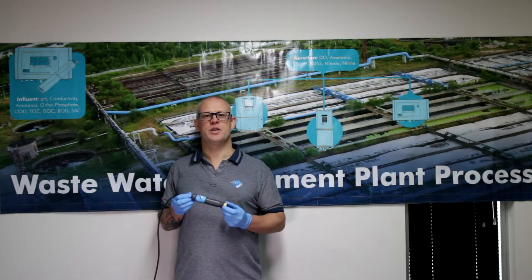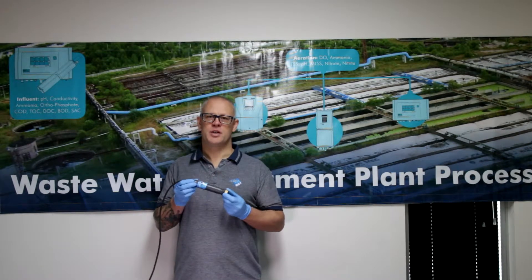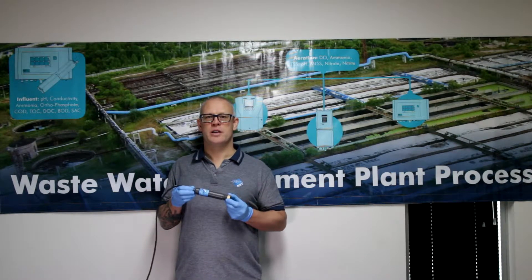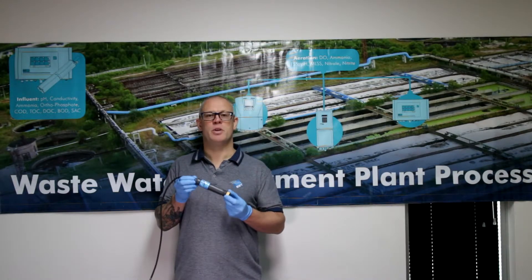Hello and welcome to this instructional video on how to charge your Royce G95A dissolved oxygen sensor for first time use.